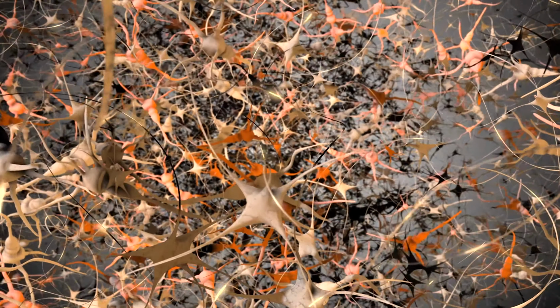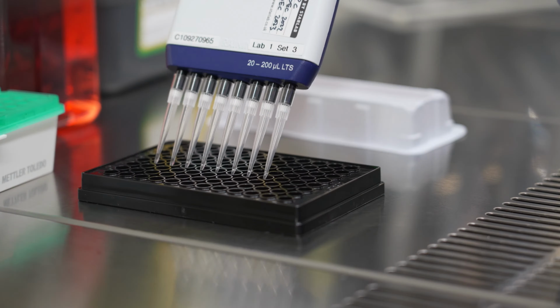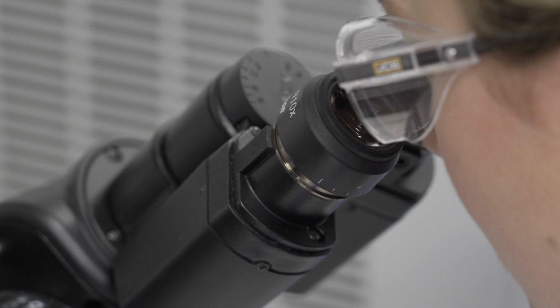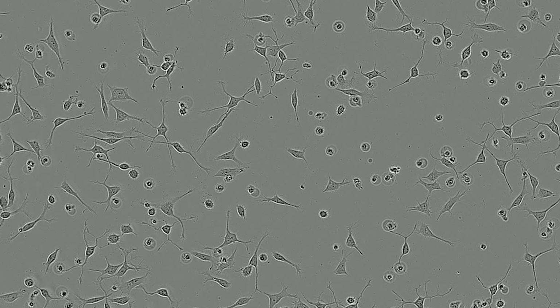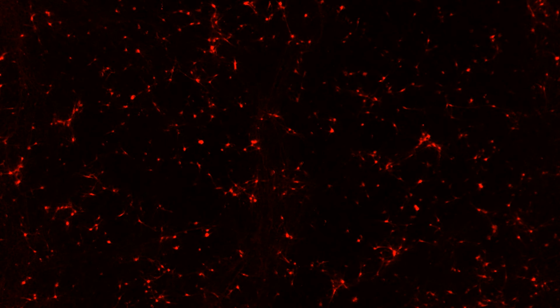This neuronal activity assay is a robust, higher throughput and relatively simple way of measuring the formation of neuronal networks and analysing their electrical properties in human cells in vitro. We're using these techniques to assess the effect of central nervous system therapeutics, as well as using it to understand the phenotypic differences between healthy neurons and those with mutations that lead to neurodegenerative diseases.